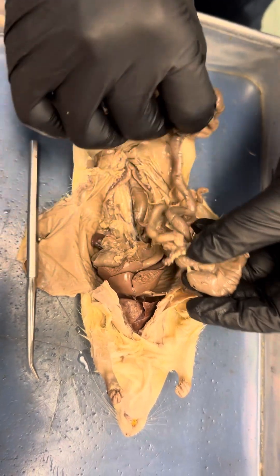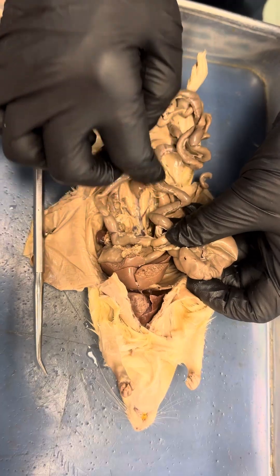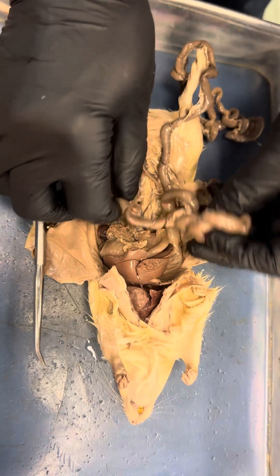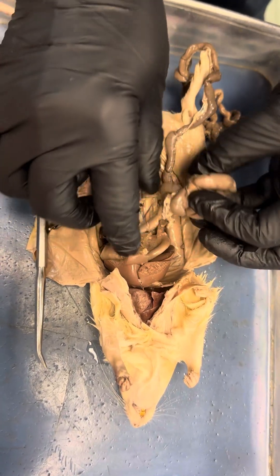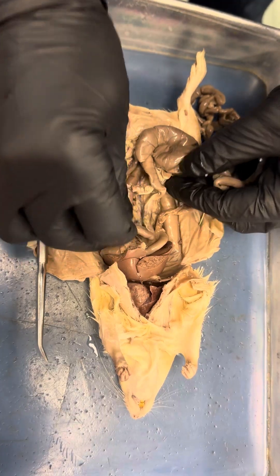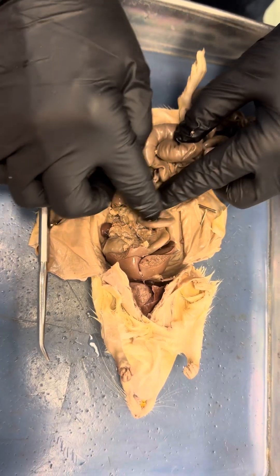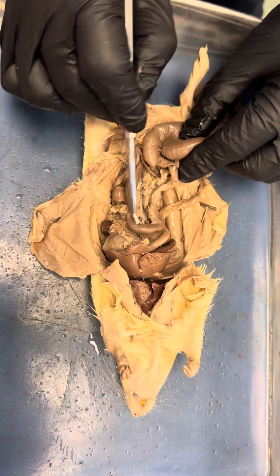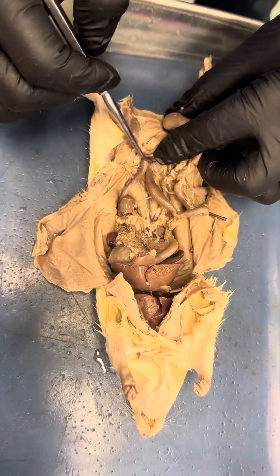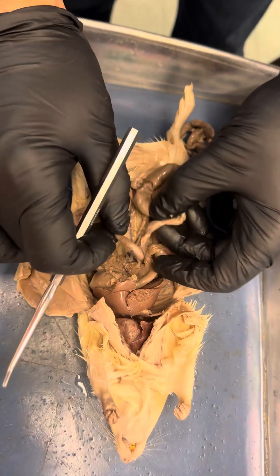The cecum connects to the ascending colon right here. This is the ascending colon, and it becomes the transverse colon. And then the descending colon. There is stool also right here, and it goes to the rectum. So: ascending colon, transverse colon, descending colon.